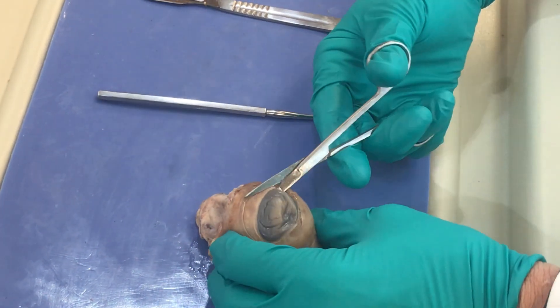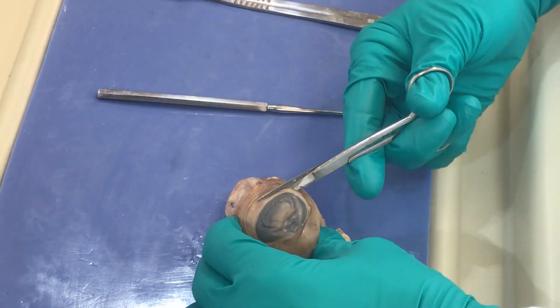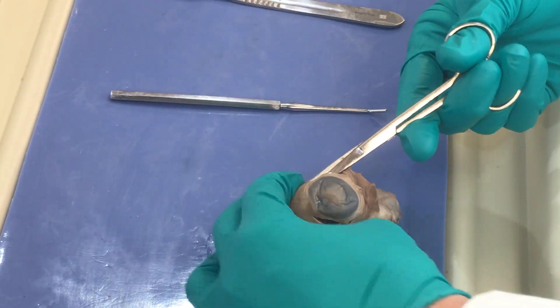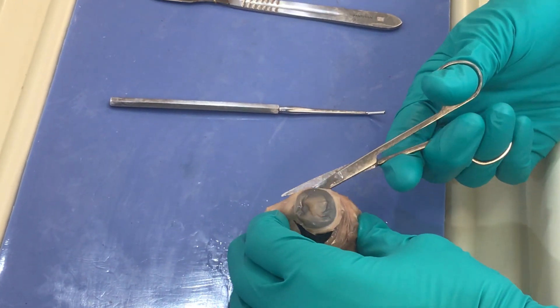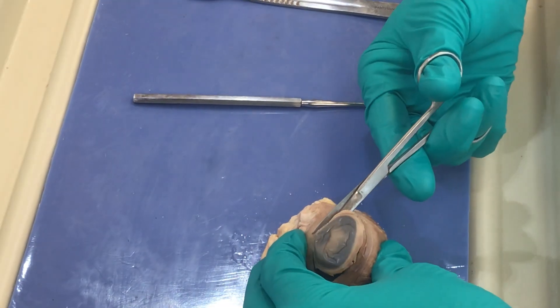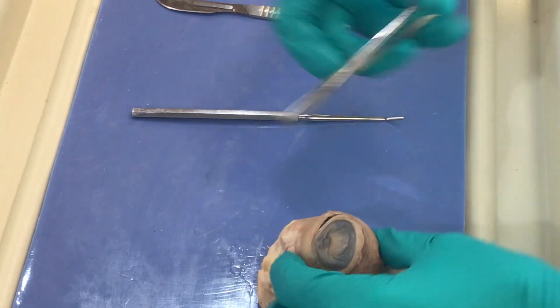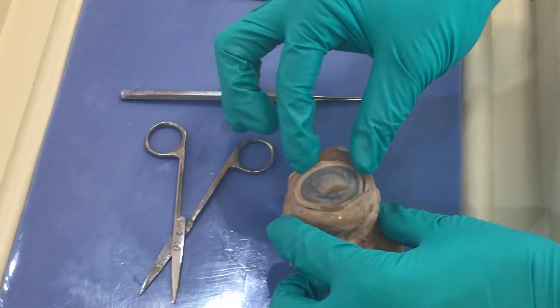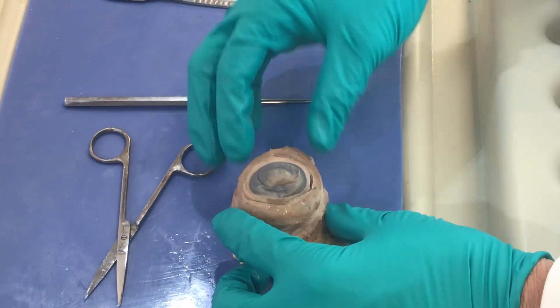There's going to be some liquid leaving the eye. If it's watery liquid, this is aqueous humor, which is in our anterior cavity — the anterior and posterior chamber of the anterior cavity. I've made an incision around the cornea, not right at the edge, so that I can maintain those structures.